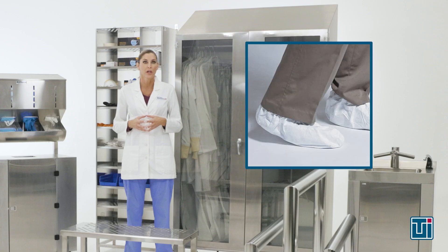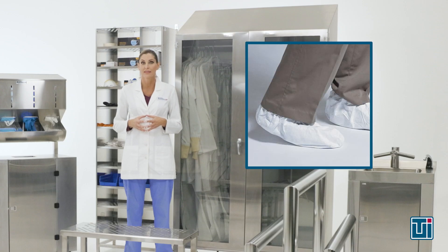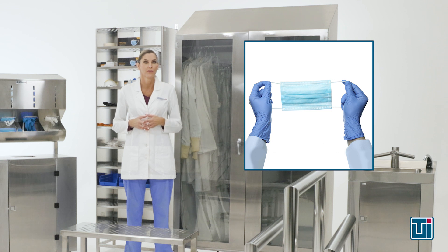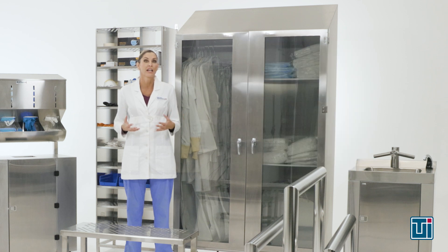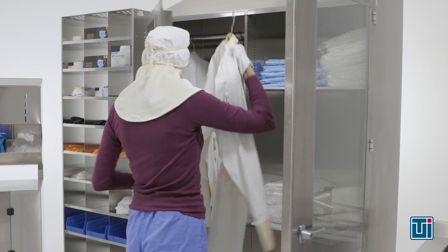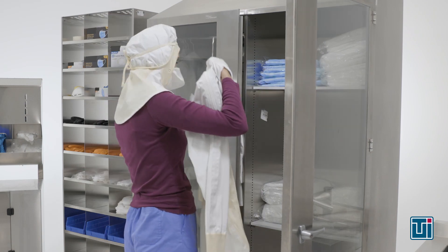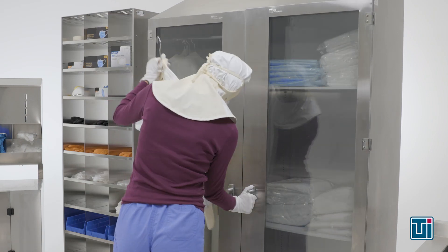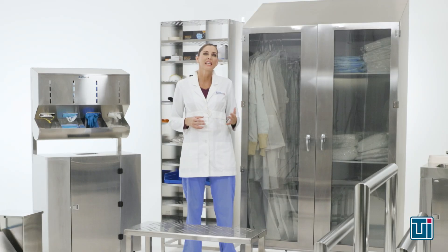Keep in mind, you'll use different garments depending on the clean room ISO classification. For ISO 7 or ISO 8 clean rooms, clean room frocks along with shoe covers, masks, and a single pair of gloves are usually acceptable. However, a clean room classified as ISO 6 or cleaner calls for more coverage, typically coveralls made from non-woven materials like Gore-Tex or Tyvek along with hoods, double gloves, and booties.